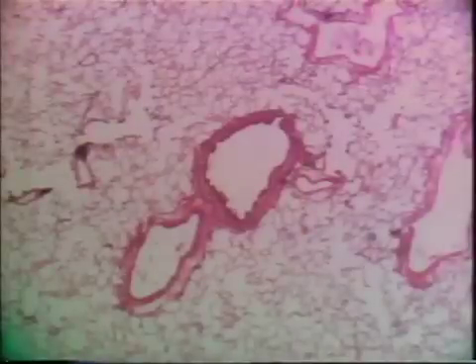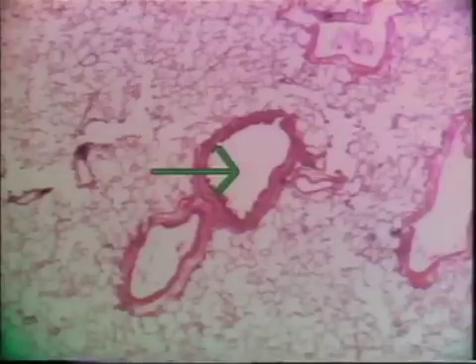The lumen is getting smaller and smaller. The major characteristic of the bronchiole now is the loss of cartilage — we're not going to find cartilage, but we'll have the same kind of epithelium. The bronchiole at the same magnification as the trachea and the bronchus shows, of course, that it is smaller and smaller.